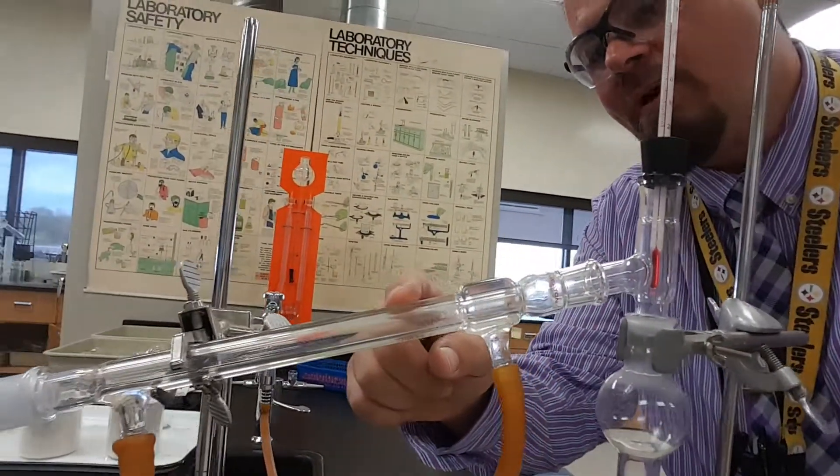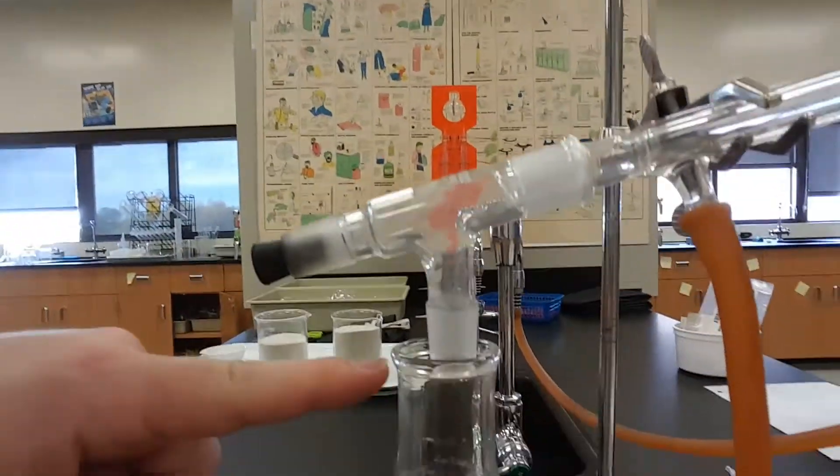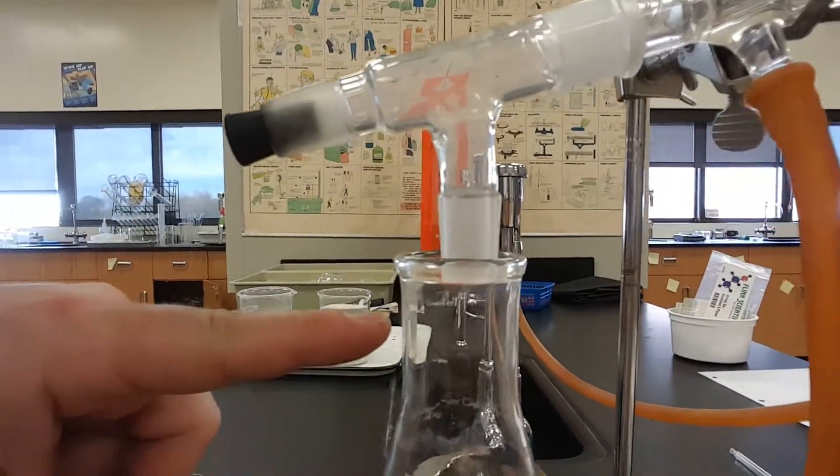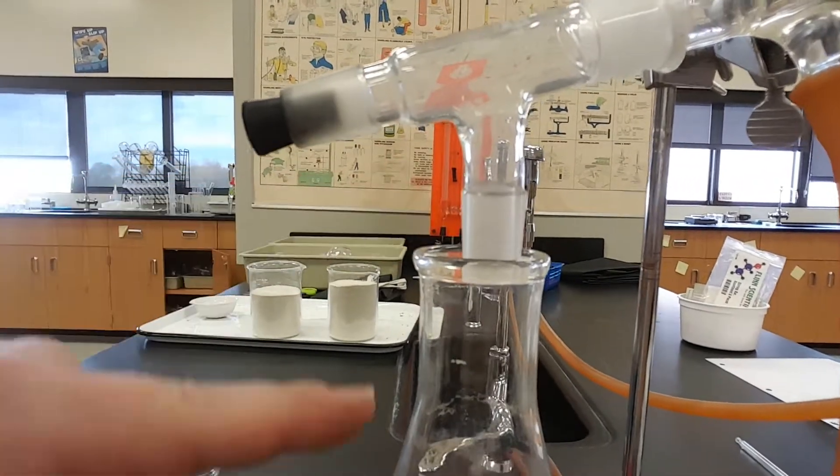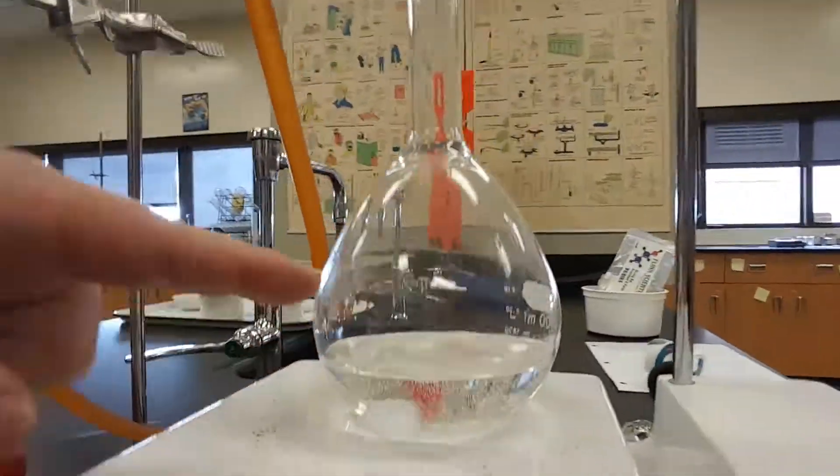And that's going to take my vapor, now that they're separate, and cool it back down into liquid. And hopefully, in a little while, these things take a long time, it'll drip down into this flask, and we'll be able to collect it. So we won't have a mixture anymore.